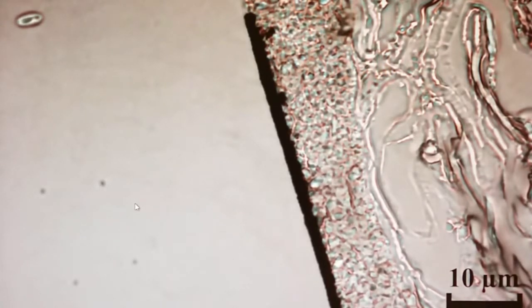And all these views we've seen now, that is bright field imaging. You can go and see how dark field imaging will look at the same image. So we go to and study transmitted dark field.